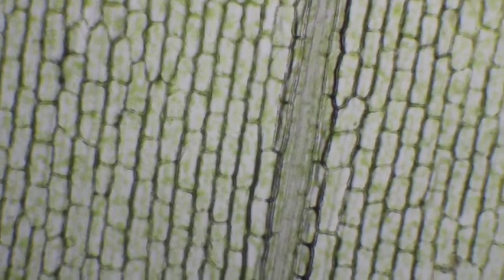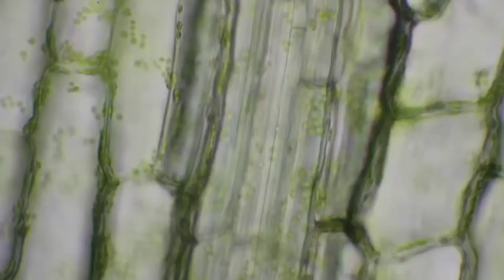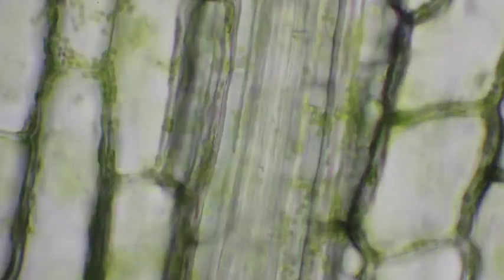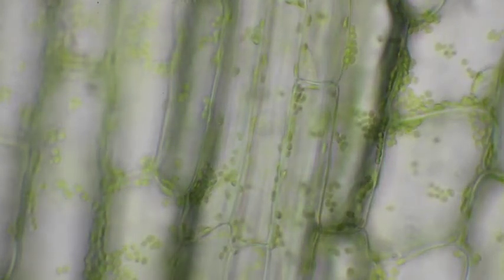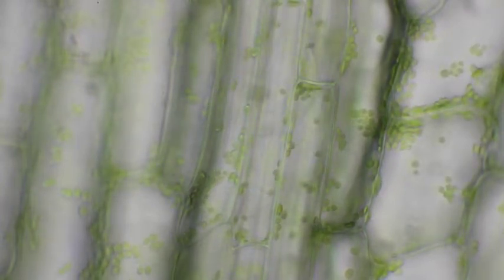I'm going to look at the vascular tissue. We'll put this vascular tissue dead center, go back up to 40x, and refocus. Cytoplasmic streaming is basically the process of these chloroplasts moving all around the cells. We can see all those chloroplasts moving around those cells really, really fast. That cytoplasmic streaming shows off the central vacuole right in the middle. We can see cell walls clearly here; the membrane is right on the inside of the cell wall.